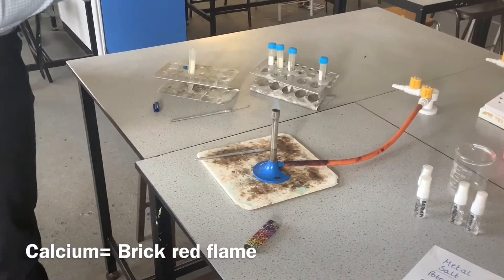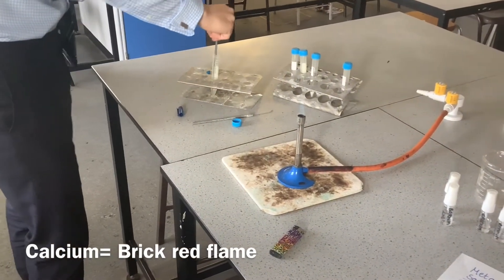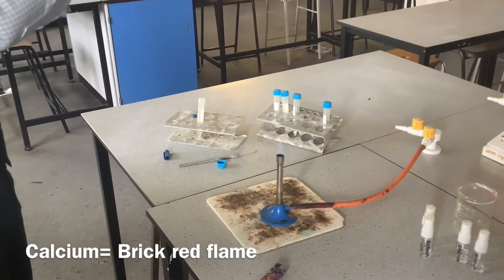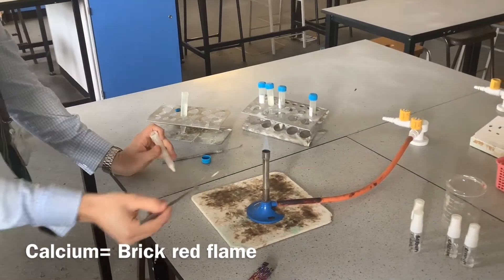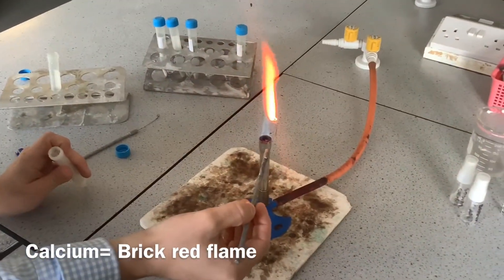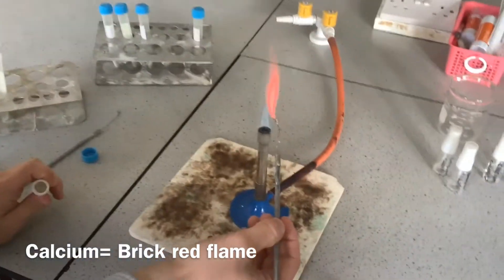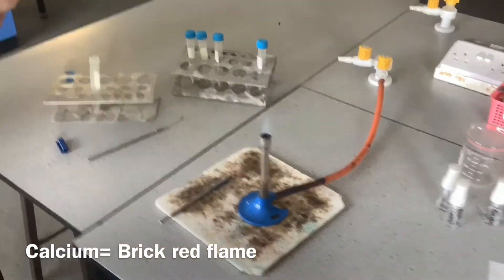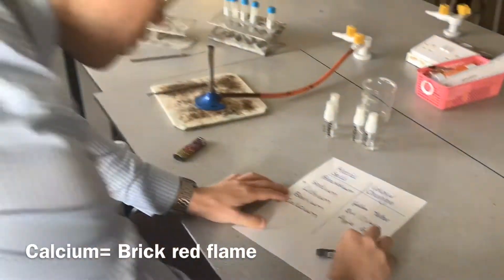We've got two left. We're looking at calcium hydroxide. Now this one does go red, but the key terminology we're looking for is brick red. They are asking you — you will not get the mark for just saying red. There's the colour change. So we've got calcium, and we're looking at brick red.